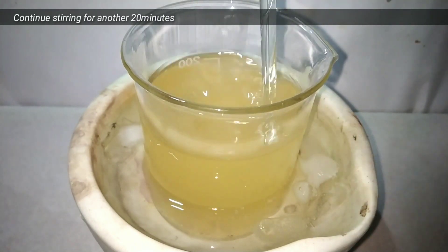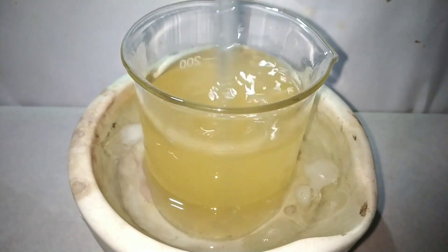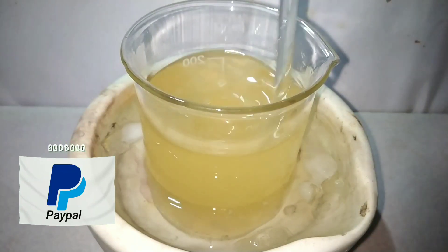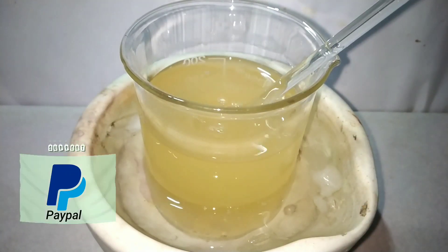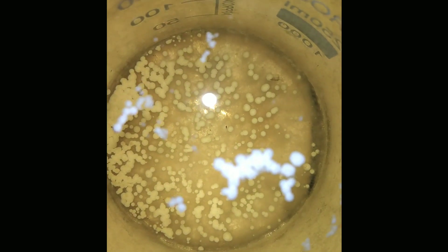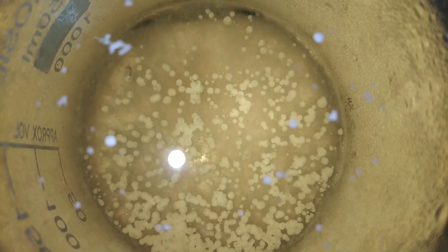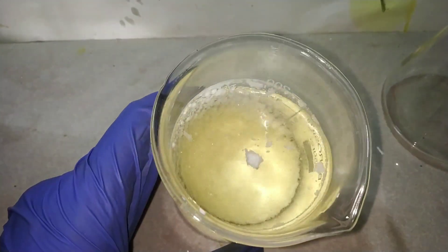After complete addition of hydrogen peroxide, continue stirring with the help of a glass stir rod for another 20 minutes. After stirring for 20 minutes, I kept it undisturbed overnight and you can see that crystals have started to form. You can see that complete crystallization has taken place.